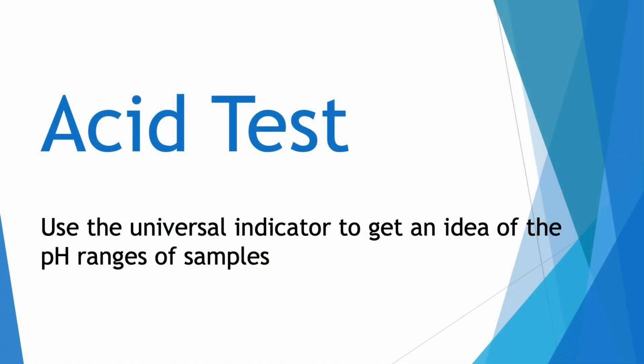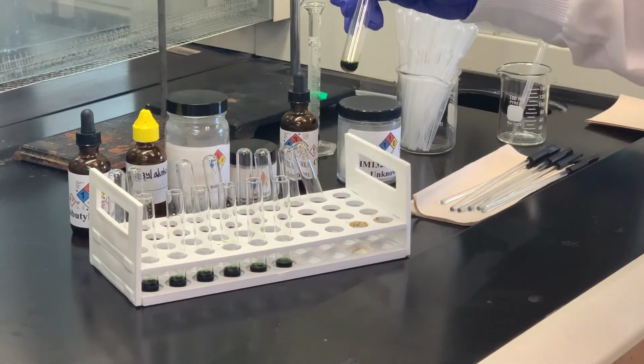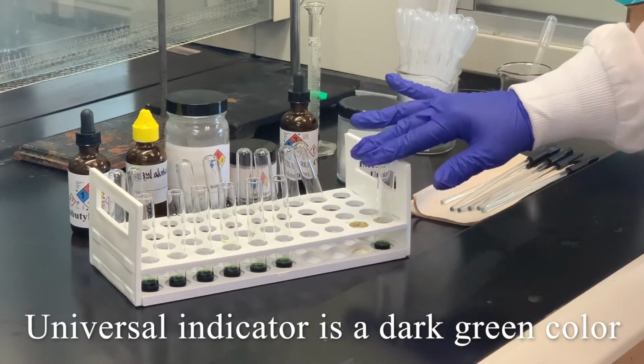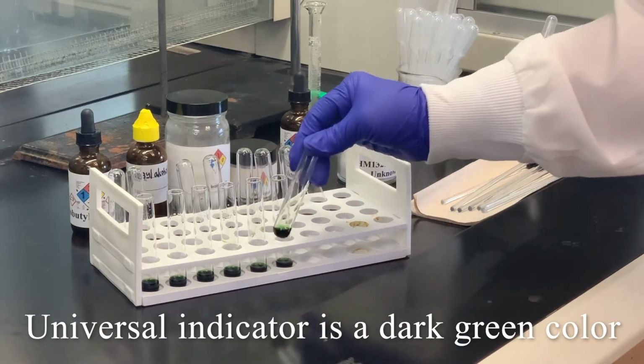The first test we're going to do is the universal indicator, which is measuring the acidity or checking for acidity characteristics. So what I've done is to prepare a blank of the universal indicator, and you can see that is a dark green solution. And this is going to serve as our blank because if nothing happens, it should stay that same color.